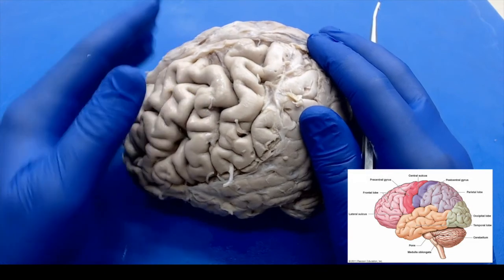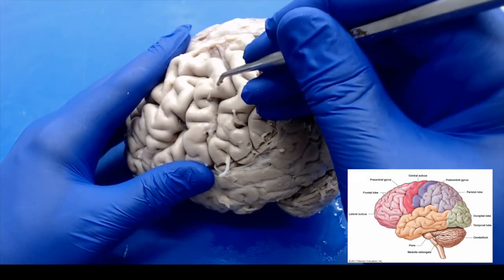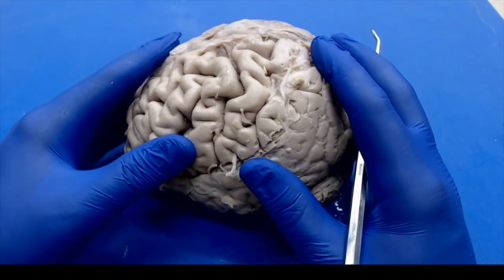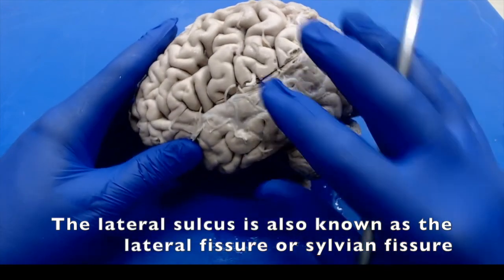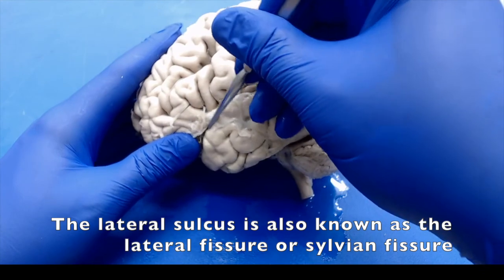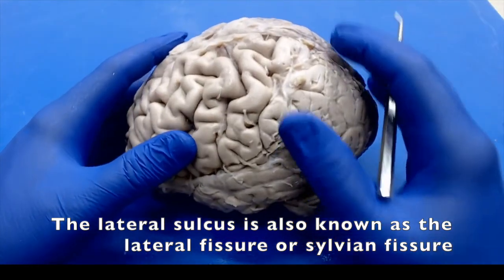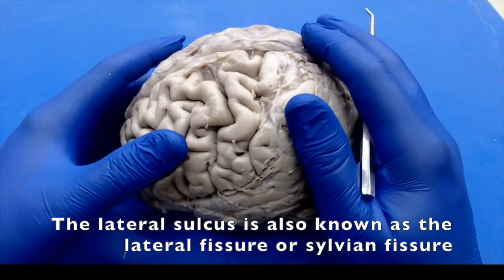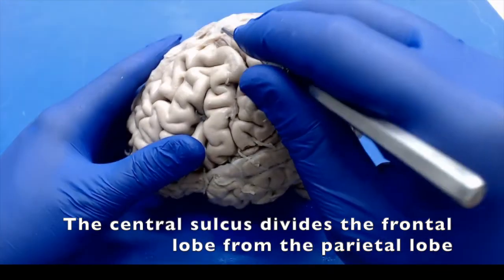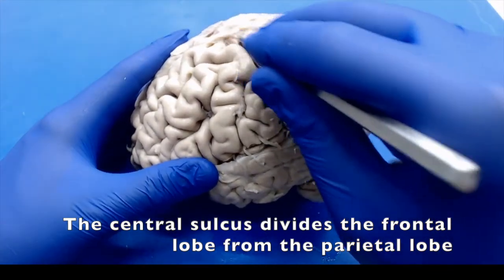When we look at some of the gyri and sulci on the brain, there are a few that you'll learn in more detail in neuroscience, but a couple you can identify particularly. The one between the parietal lobe and the temporal lobe makes that characteristic fold in the brain. That is your lateral sulcus, so that one should be easier to identify. One that's kind of tricky but usually prominent on every brain is the central sulcus. Look for the midpoint of the brain for the central sulcus. It'll be the dividing point between the parietal lobe and the frontal lobe.